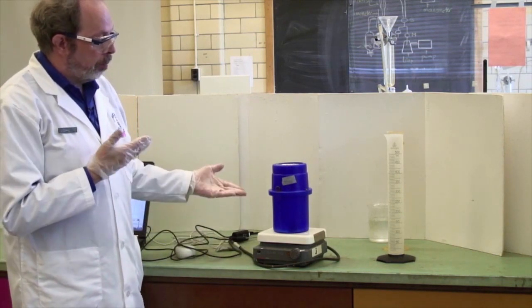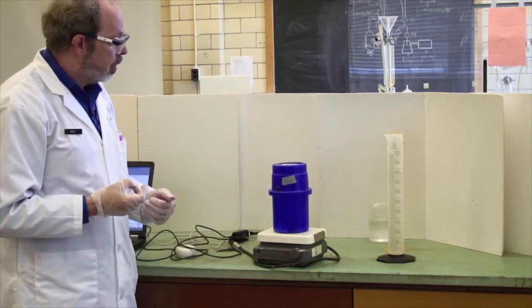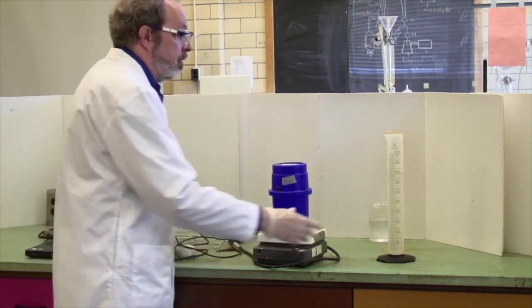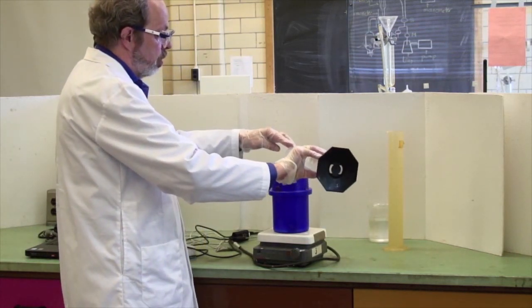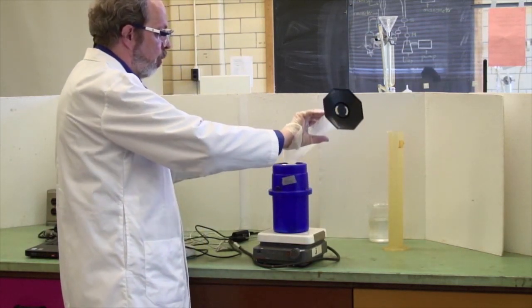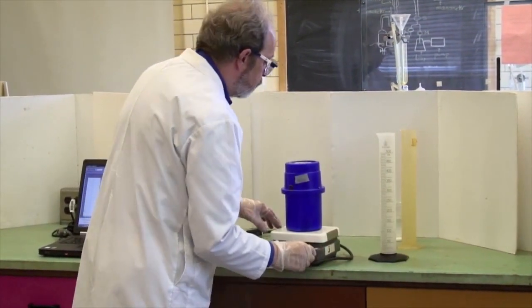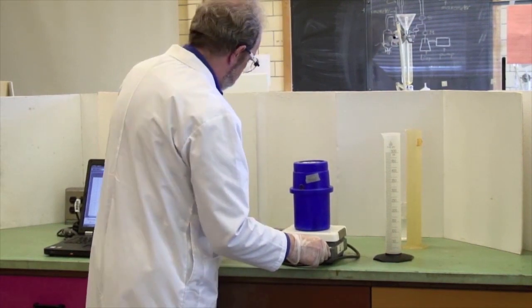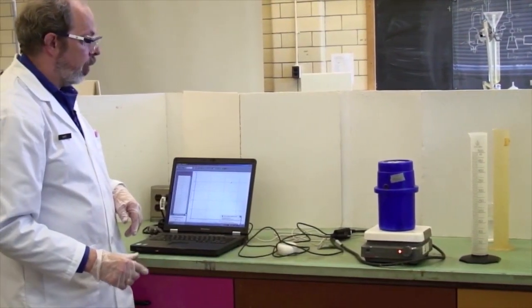We will be using hot and cold water. We'll use 400 mils of each. So first thing we do is, it's just room temperature water, we've got 400 mils of cold water here and I'll just pour that into the calorimeter. Turn the stirrer on. It's actually mixing there and by this point this is now ready to go.